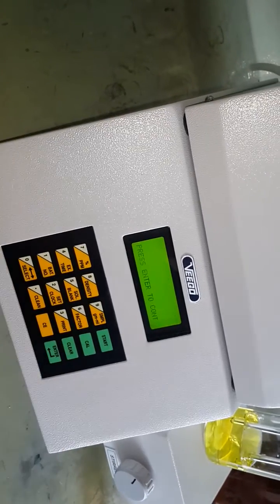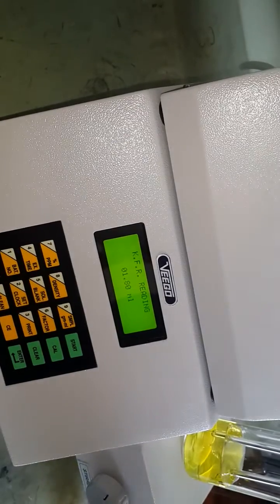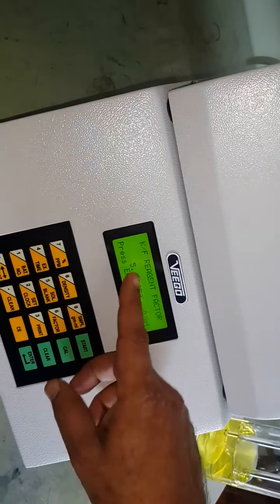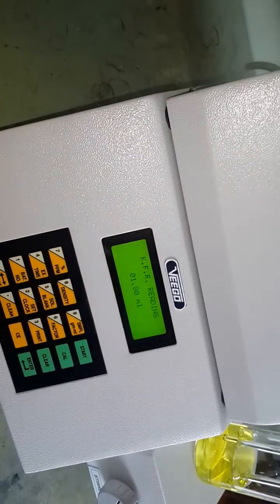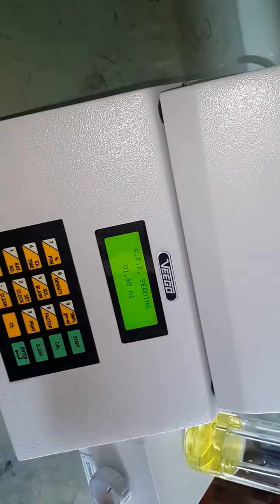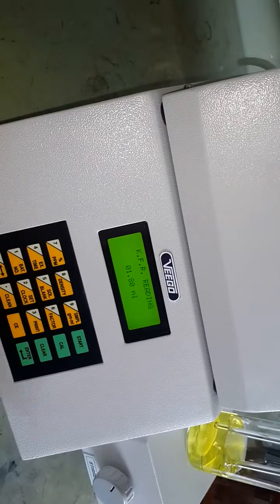Press the enter key — the titrator is now ready to test samples. Press the factor key to read the factor and press enter to register it. We will now take a solid sample, enter the sample quantity, and find the result.